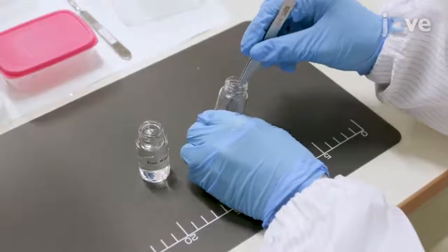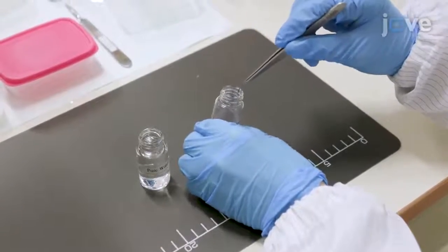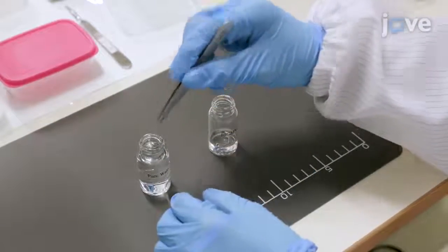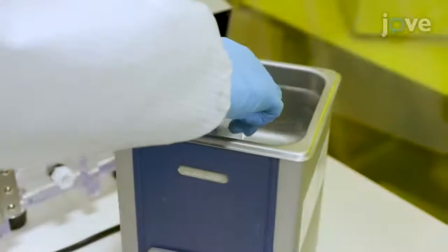After retrieving the pins, transfer them with tweezers one by one to a container of deionized water. Next, sonicate them in the water for 5 minutes.